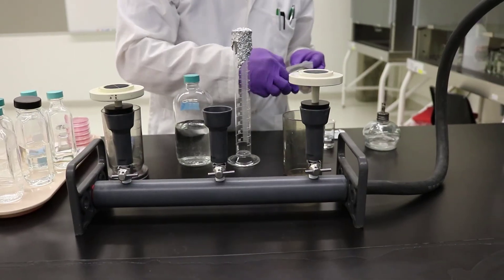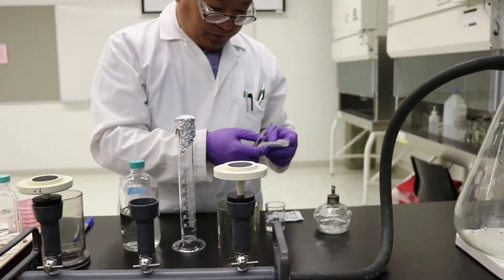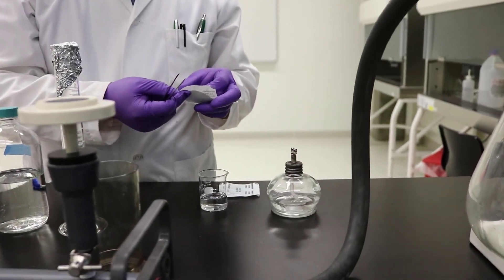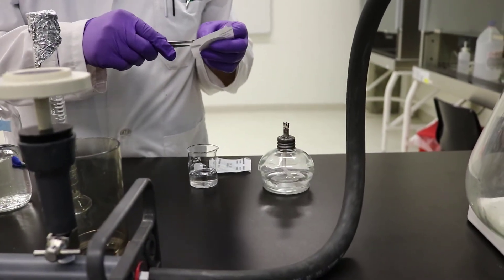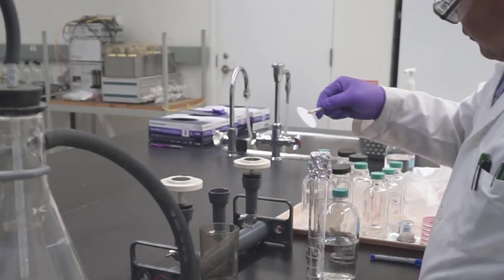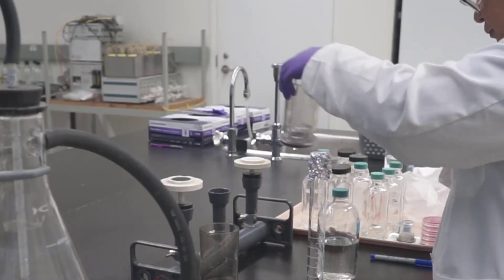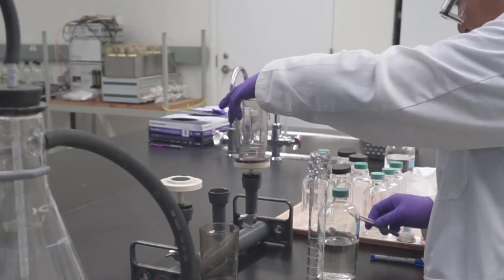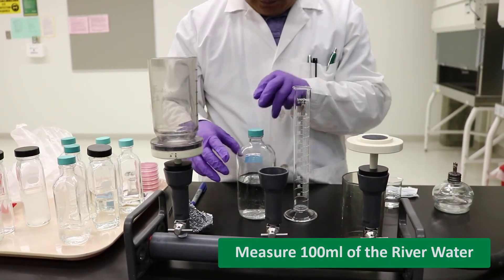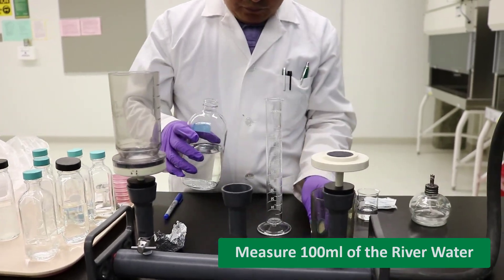For sample B, instead of performing serial dilution, simply measure 100 ml of the river water using a sterile graduated cylinder and repeat the filtration from the previous steps using another filter unit. Again, place the membrane in the agar plate.